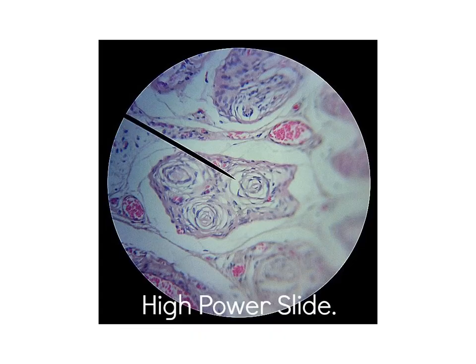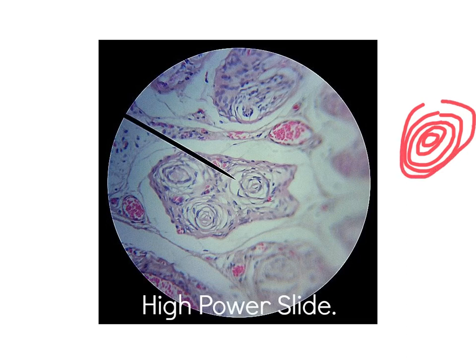This is the second high power slide. It's also very easy because it is a slide of the Pacinian corpuscle. As you see here, the Pacinian corpuscle is formed of concentric lamellae of modified Schwann cells. They look like sliced onion. So this appearance is very characteristic for the Pacinian corpuscle. You see these circles with the blue dots representing the nuclei of the modified Schwann cells. So this is the Pacinian corpuscle.